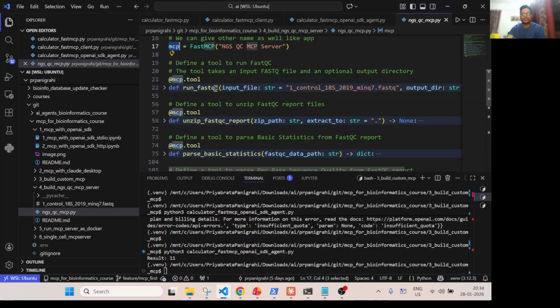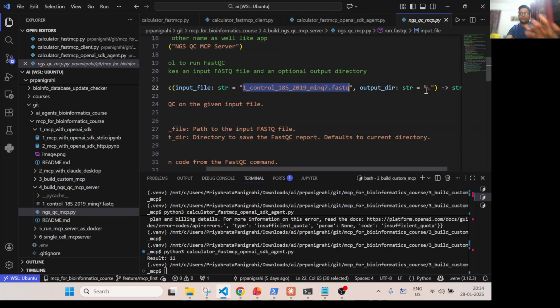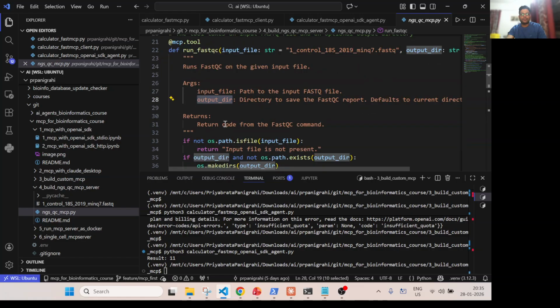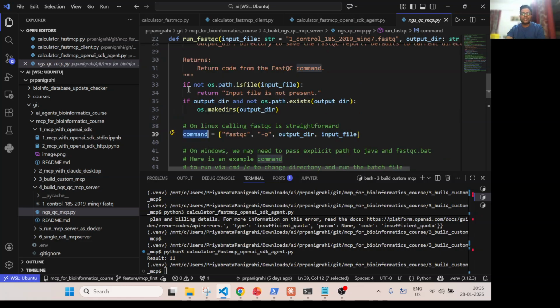The first function is run_fastqc. It takes an input file; by default I'm giving some path, but the user will give their own path, and you will specify the output directory. If it is not specified, it will run in the current working directory. Here I have given the instruction: run FastQC on the given input file. Arguments are input file and output directory, the directory to save the FastQC report, which defaults to the current directory. Then the command runs fastqc with -o output directory and the input file. This is how you pass each argument as a string in a list to create a command. Here I'm checking that if the file is not there, it will return the message that the input file is not present.